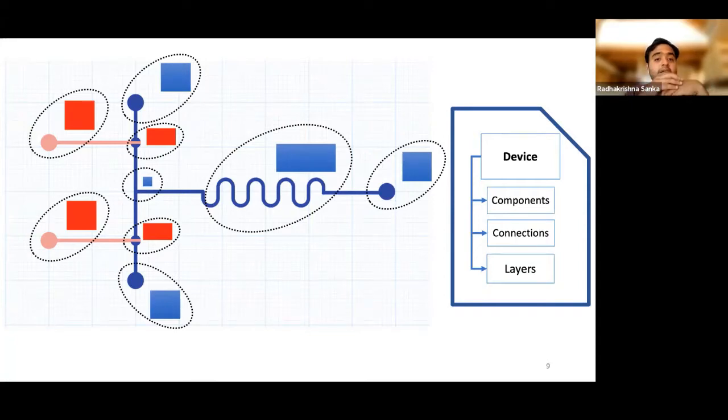The reason why storing the design like this is superior to how you do it in AutoCAD or SolidWorks is because now we actually know which functional components are connected to each other. For example, in this design, if you can see my pointer, the little round thing is what we call a port, where you put in a fluid input. And this other structure, these little half moon structures, is what we call a valve, which controls whether or not the fluid flows. And this serpentine looking channel is what we call the mixer.